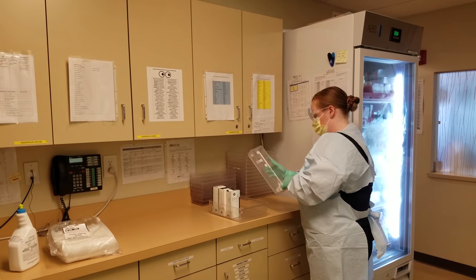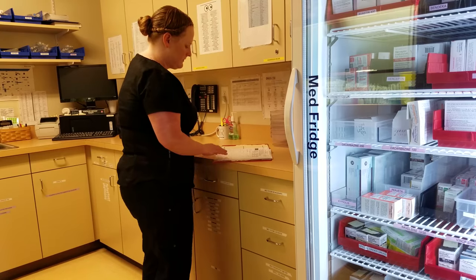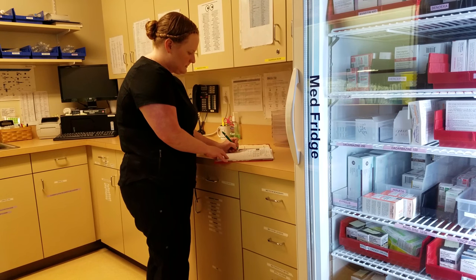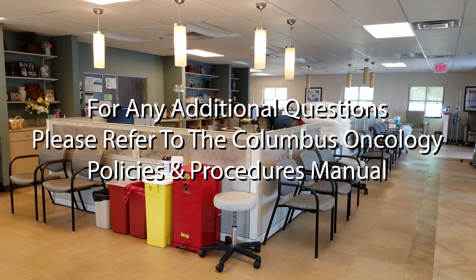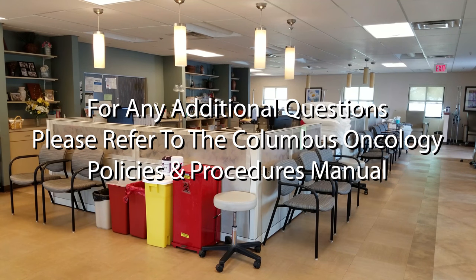Always make sure to document your work on the tracking log that is located in the mix room. If you have any additional questions, please refer to Columbus Oncology's Policies and Procedures Manual. This concludes Columbus Oncology and Hematology Associates' Mix Room Clean Procedures.